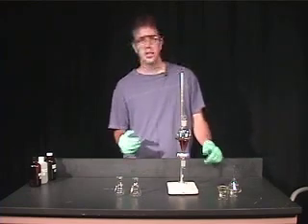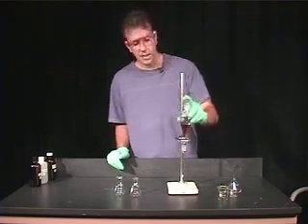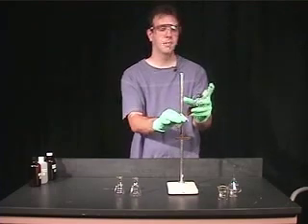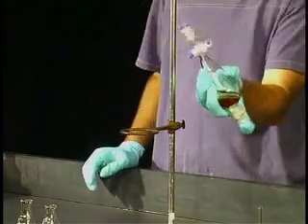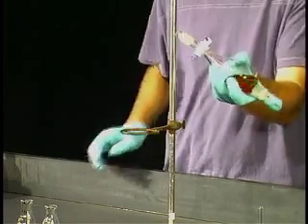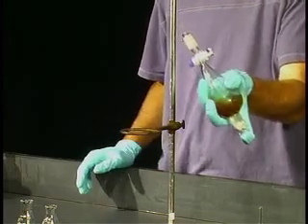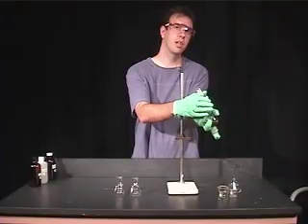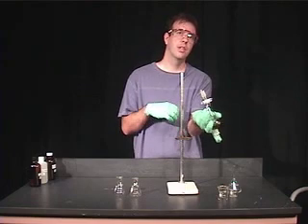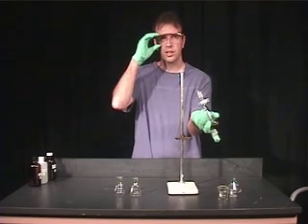There are two different ways you can mix material using a separatory funnel. Generally you want to grab it with two hands, invert it, and release any pressure that may have arisen. Then you can gently swirl the solution for 15 or 20 seconds and release the pressure. That's one way of doing it. The gentle mixing is very important when there's a possibility of forming an emulsion — I'll describe that a little later and actually show you what an emulsion looks like.